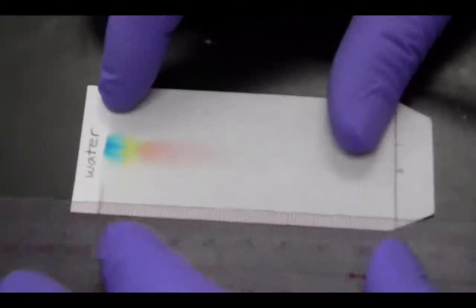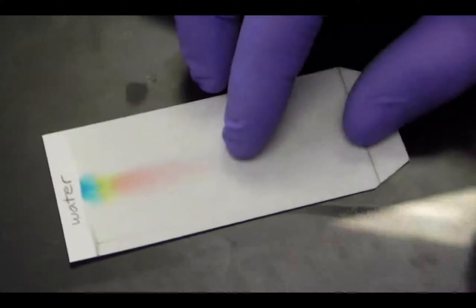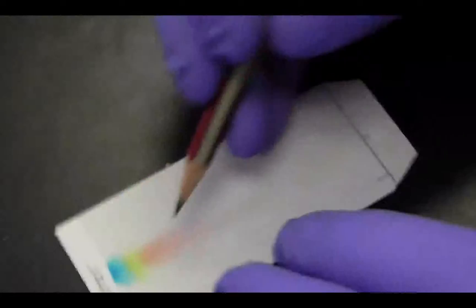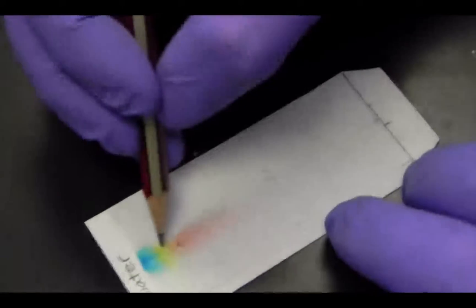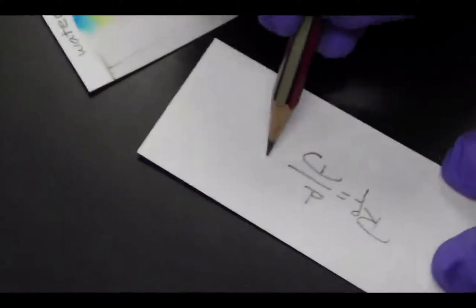To calculate the RF, you need to measure the distance traveled by the solvent — that's going to be the capital D — and the small d traveled by each of the colors. So you calculate the small d for red, the small d for yellow, and the small d for blue. Then RF is equal to small d over capital D, and it's going to be smaller than or equal to one.